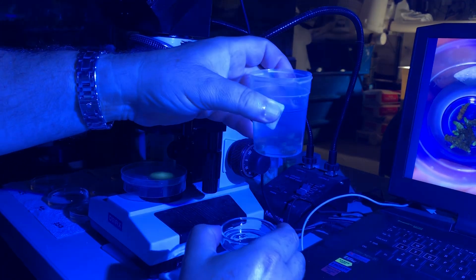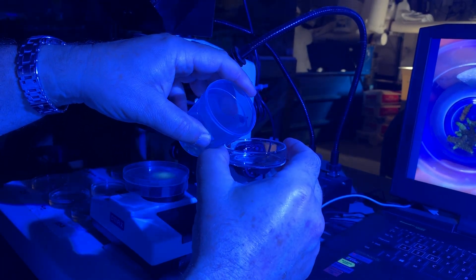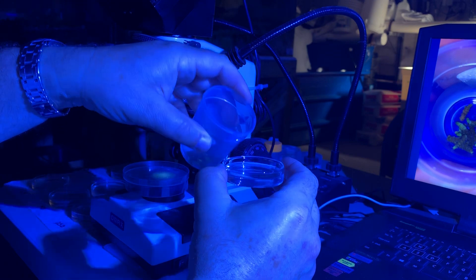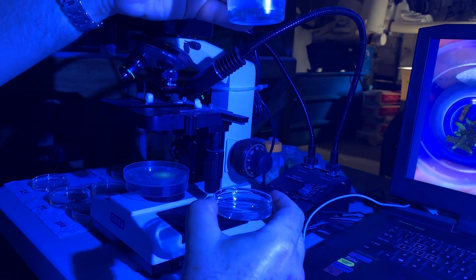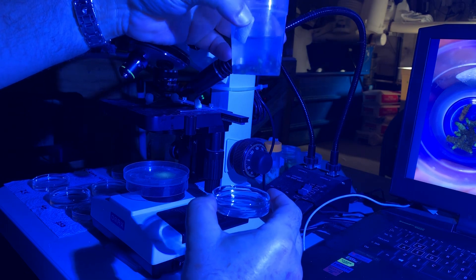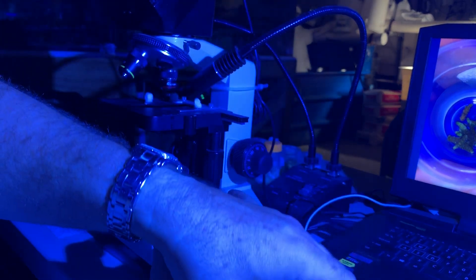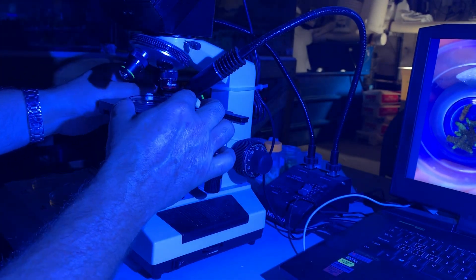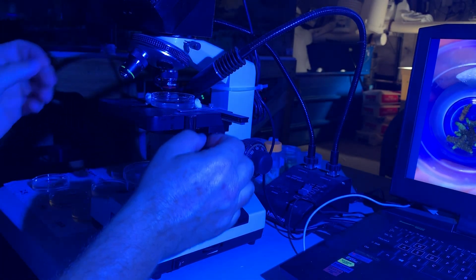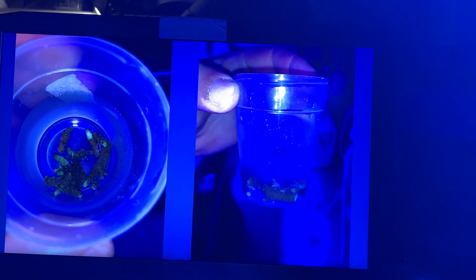Here is the cup, here is the petri dish. We are going to pour some of the liquid from the cup. There are the tips — you can see there is still coral tissue on them and they still have the burnt tip appearance. Next we are going to put that water that they have been sitting in overnight, which was regular saline, and look at the microscopic view on screen.